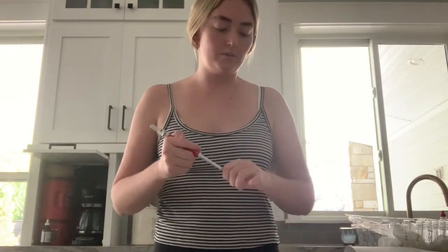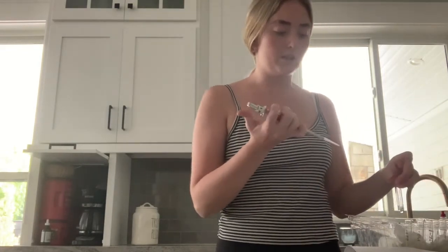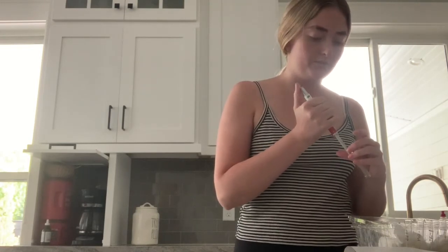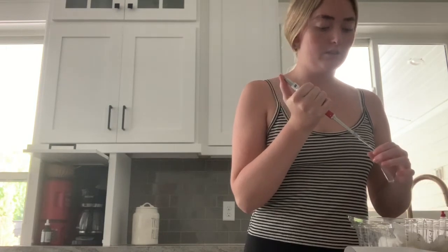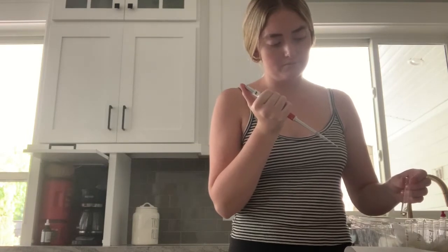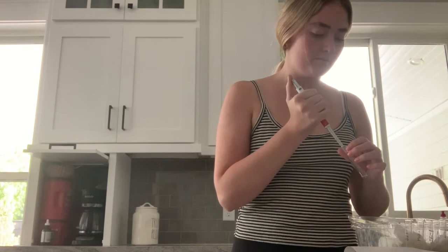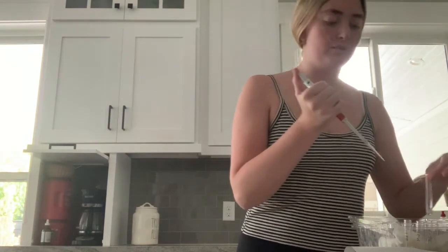Okay, so we're letting that control sit for a second, and then I'm taking 200 microliters of that first test tube that has the urine and the diluted water, and pipetting it into the next test tube to dilute it with the next amount of deionized water. You mix that, and then we're taking 200 microliters of that sample and placing it in the next test tube. We're continuing this process all the way through our test tubes.